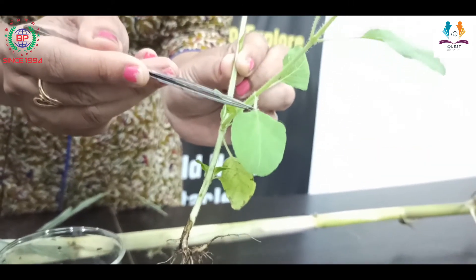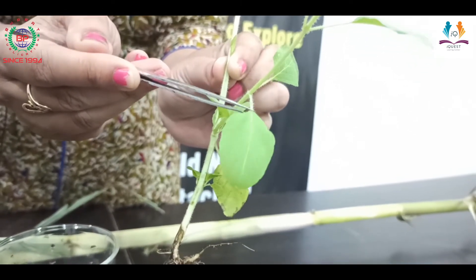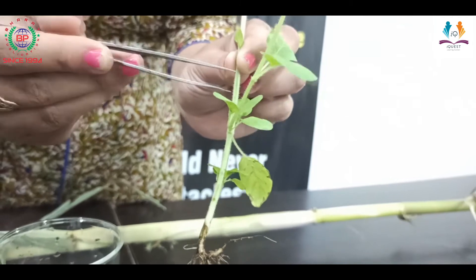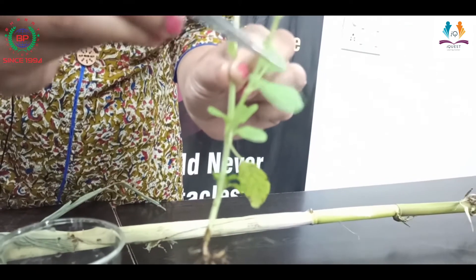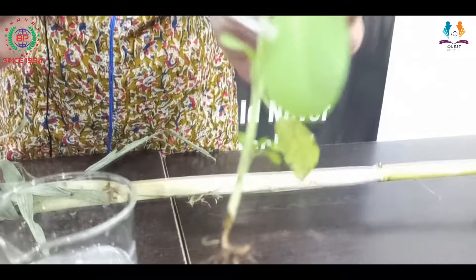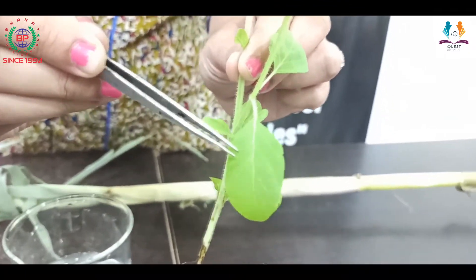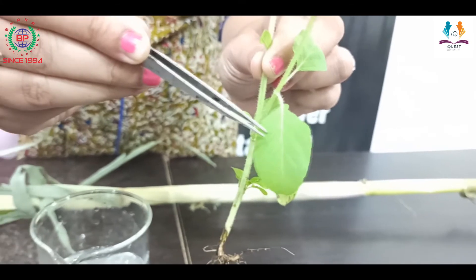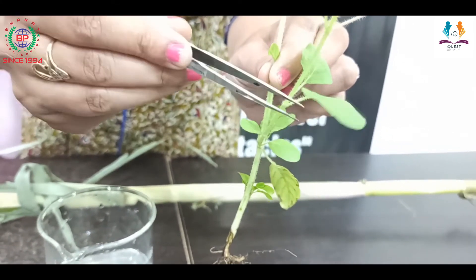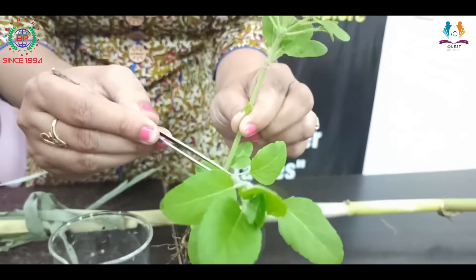Now we will check the type of leaf venation. This type of leaf has one main line and small lines coming out from it — these are the veins. This type of venation is known as reticulate venation, and this type of venation is always seen in dicot plants. This is all about the dicot plant.